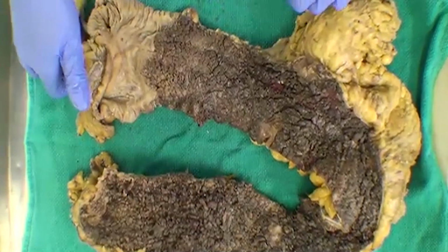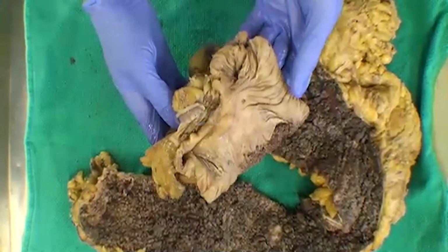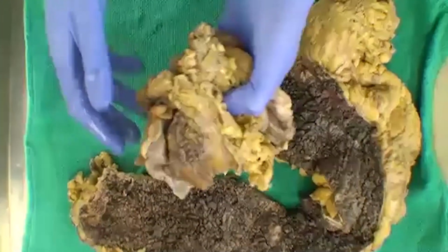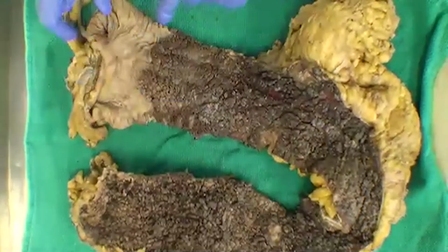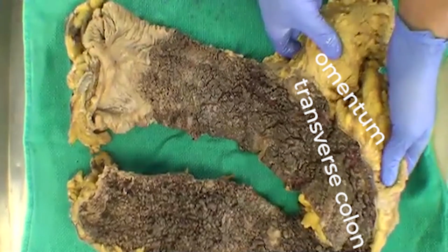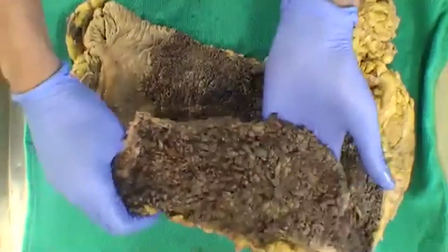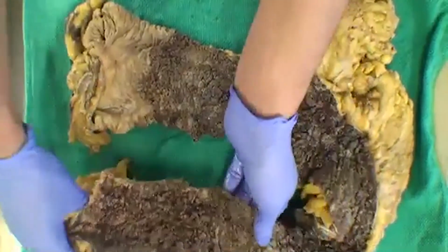If we were just to review our anatomy here, this is our proximal end, our cecum. On the flip side, to prove it, we have the appendix over here. We then have our ascending colon. We have our omentum hanging off as a good anatomical landmark of transverse colon. And then we get into our descending and possibly sigmoid colon. So this is close to a total colectomy.